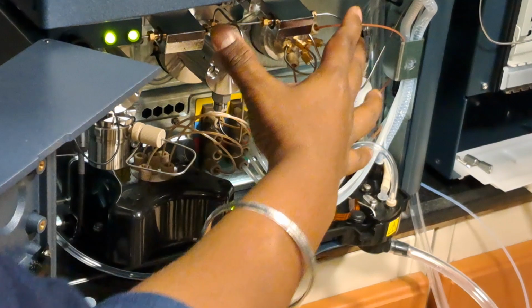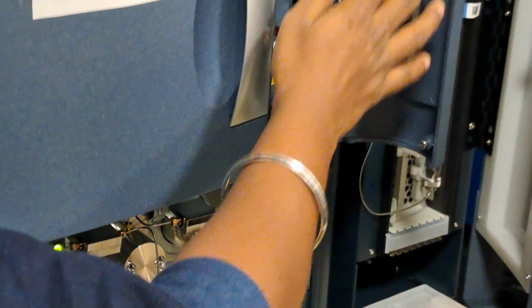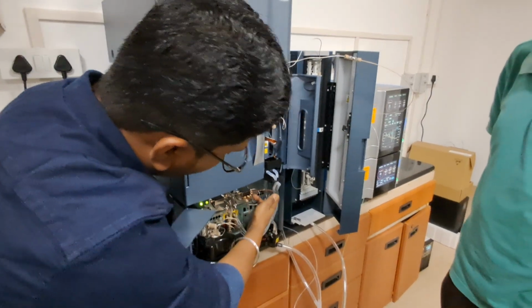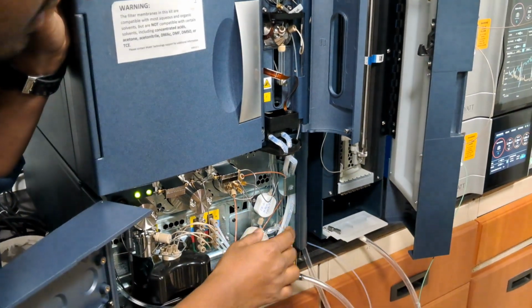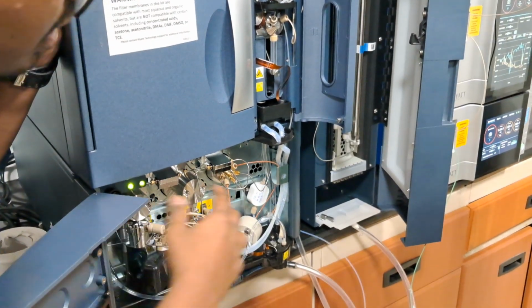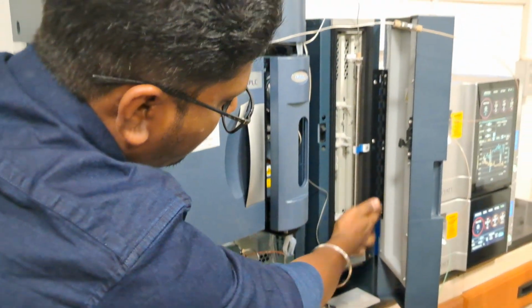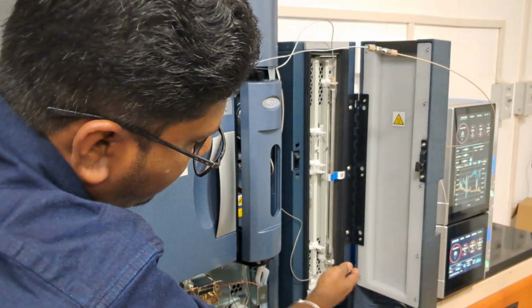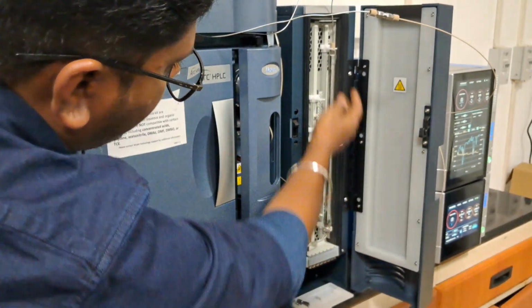In the pumping part, the main thing is the SS connections going here, and there should not be any leak in the SS connections. Usually it won't happen. The main worry is where you connect the PEEK tubing, which is only hand tight. So if any leak comes, it comes from here, especially if more back pressure is created. The next place a leak can come from is the column inlet end. We tighten it by hand only, so we can get a leak here and here.